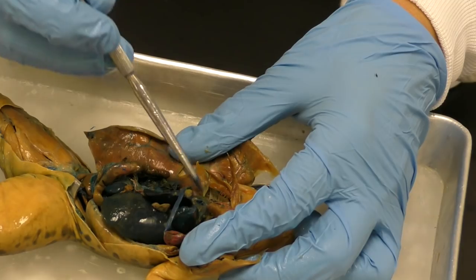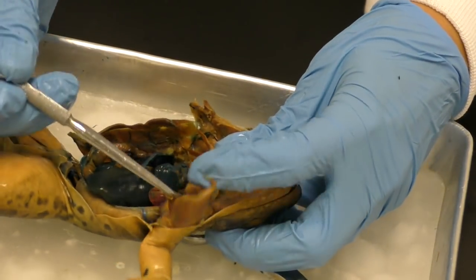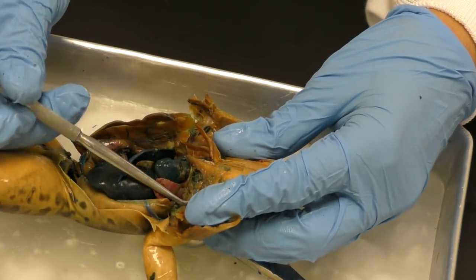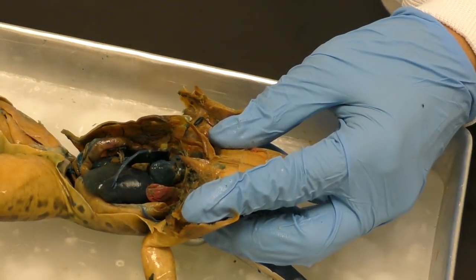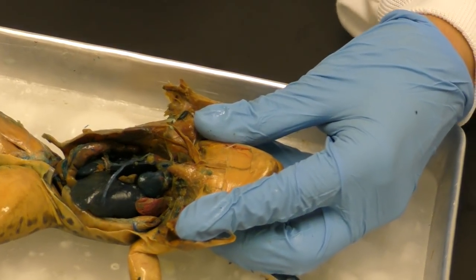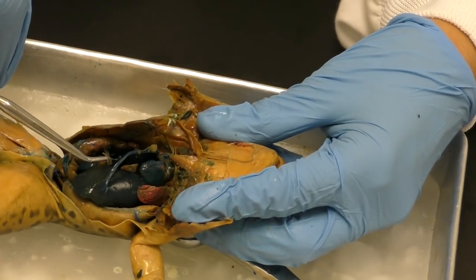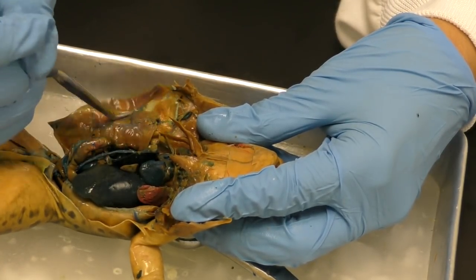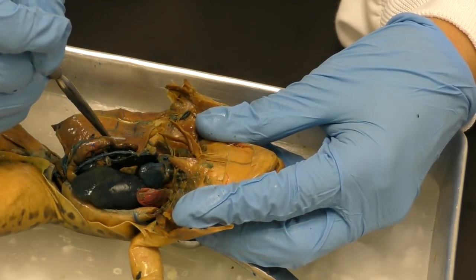dyed blue. That's just the color choice that they used, but then you can also see that there's some dyed red. Okay, so there's this common misconception that your blood is blue until it's oxygenated, and that is a lie. Your blood is all the same color as it moves through your body, but the reason why this misconception came about is because of these preserved organisms.